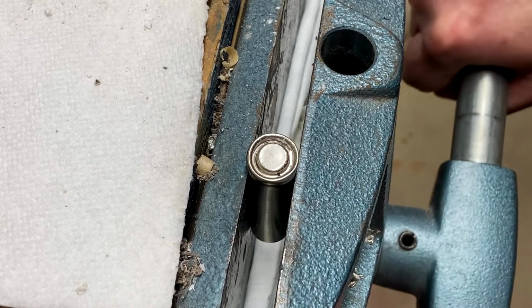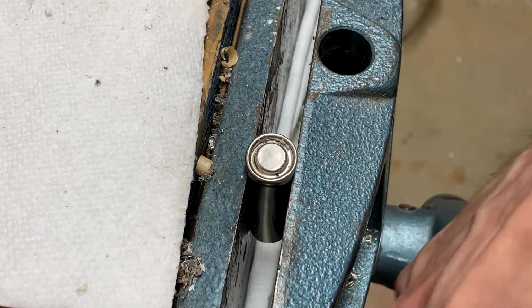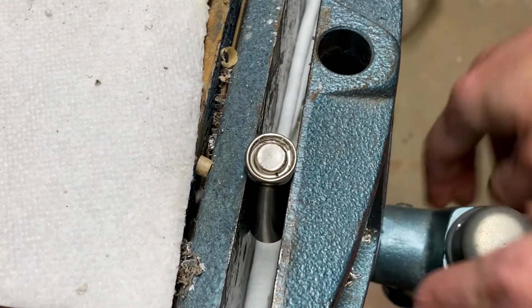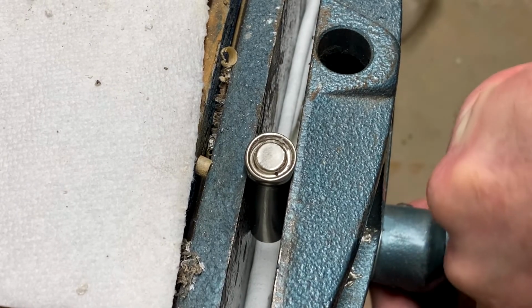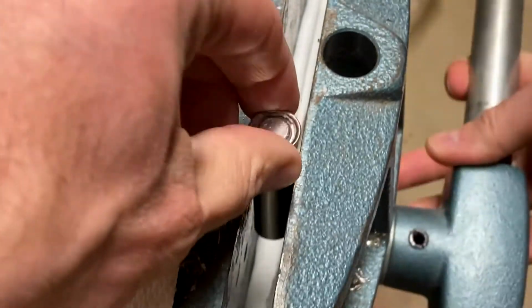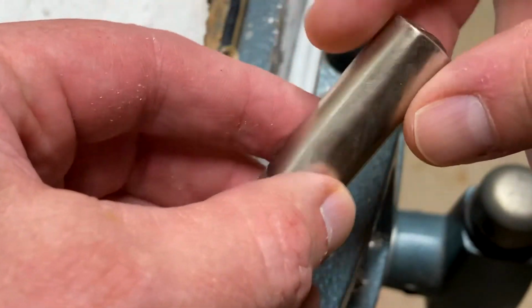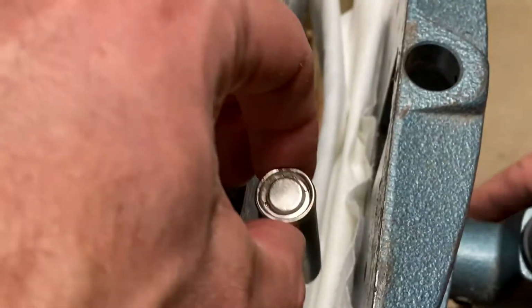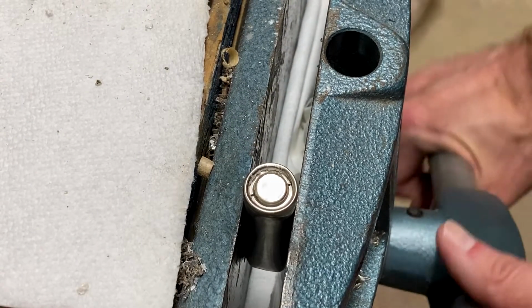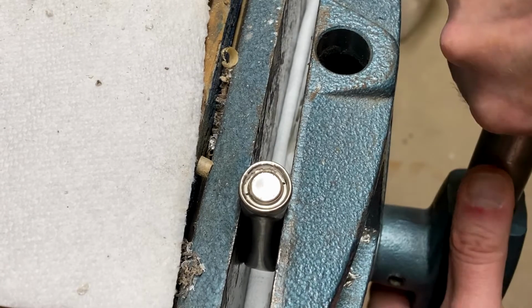Don't mind the squeaky table. Maybe this is going to take something with a little more effort to it. Looks like something's starting to happen there. I don't quite know what, but let's see. I think all I managed to do is make a square battery here. Well, not much luck on that yet. But I'm going to try and see whether maybe I can exploit some metal fatigue and start squeezing it on the opposite side. And if not, you know, I'll have my own special brand of square AA batteries, right?